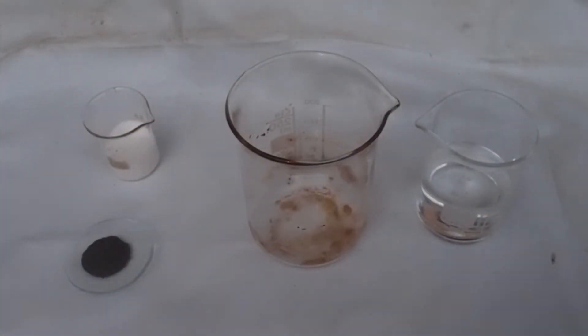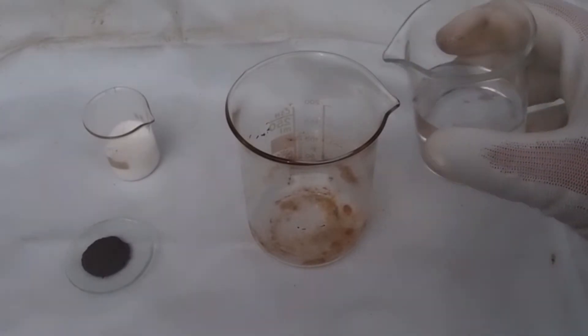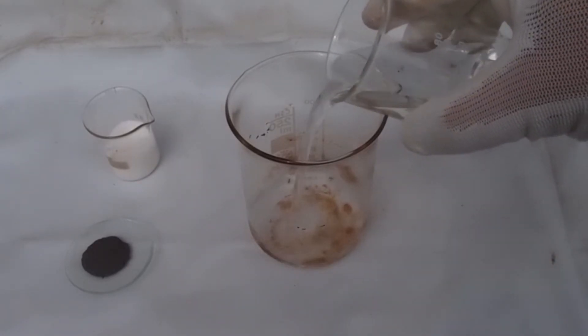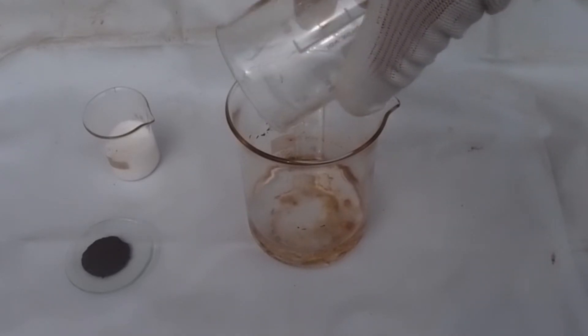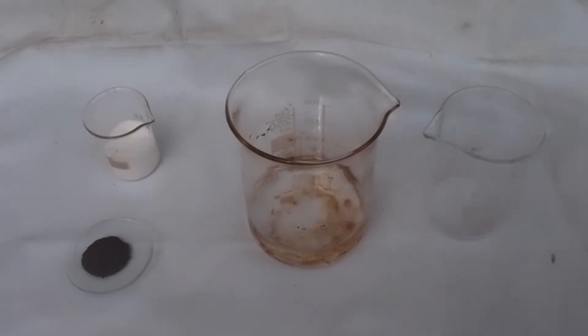You may notice the beaker I am using is a bit dirty from a previous run, but that's not really a problem. We start by pouring the nitric acid into the beaker and slowly adding the iron powder.